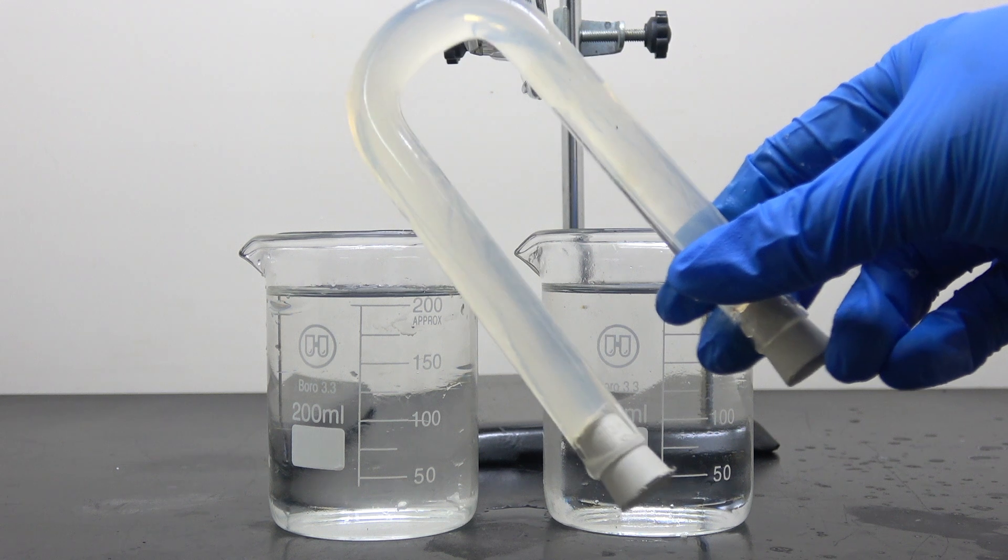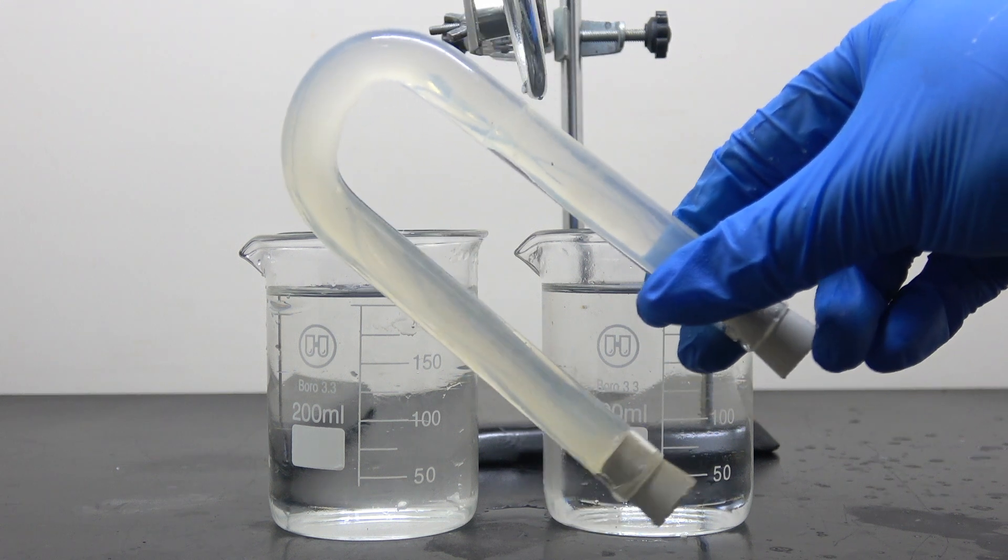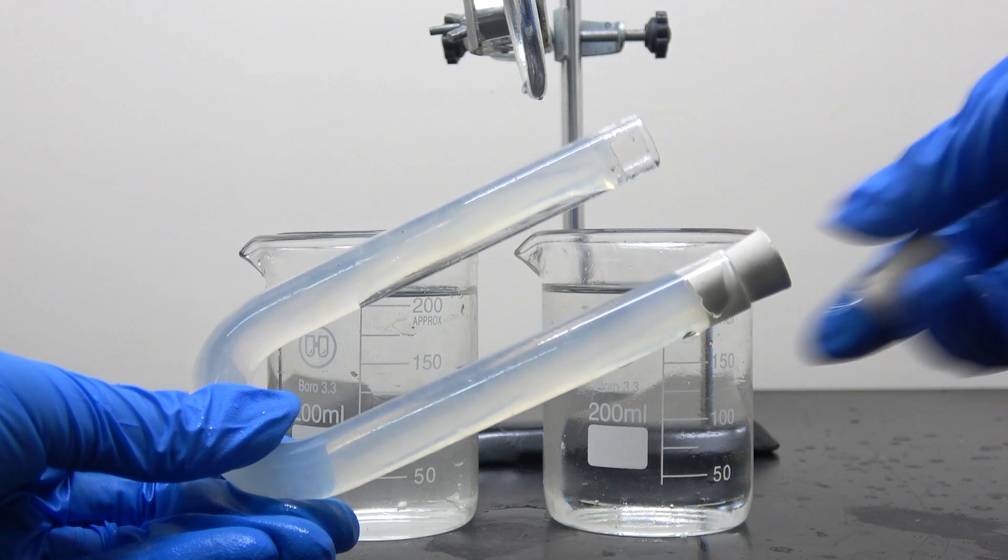This is the salt bridge, an ingenious device that makes this whole reaction sustainable. I will explain the details in later steps.